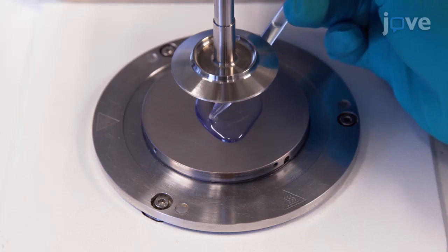Now cover the bottom plate of a rheometer, characterized by parallel plate geometry, with the photoresin.